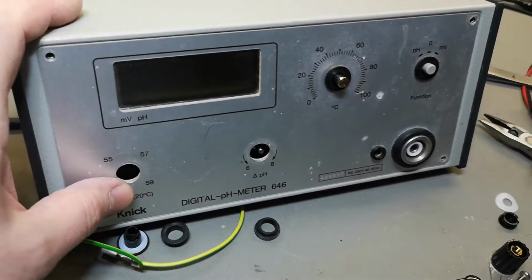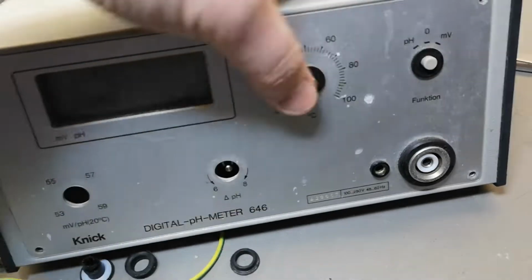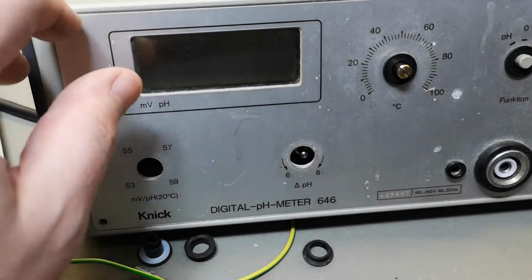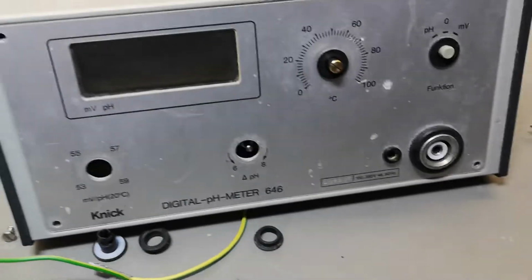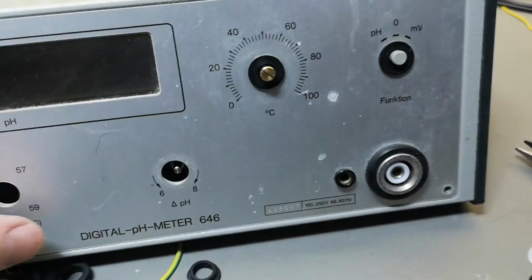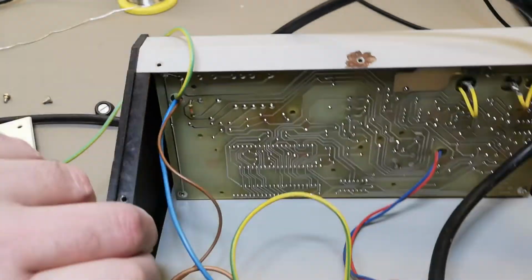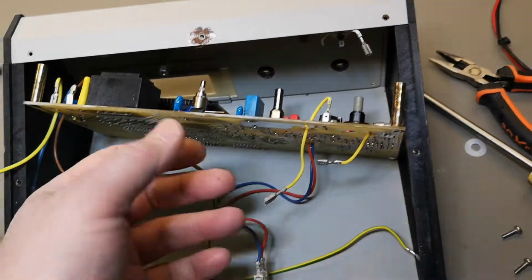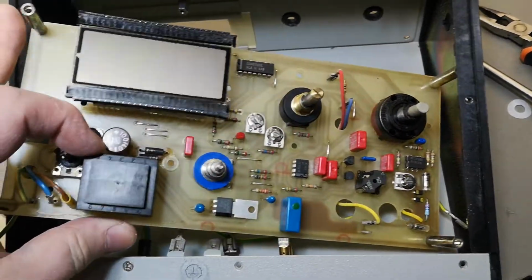So sometimes when brutality doesn't seem to work, it's because you're doing something wrong. It's always the buttons or some hidden screw behind something. Maybe we need to get the front off. It's not coming off. See, it seems like it is really... Did I forget one more screw in here? Am I really that silly? Where are you? Okay, this time it was just a matter of a little bit more force. Wow, that is a beautiful display.